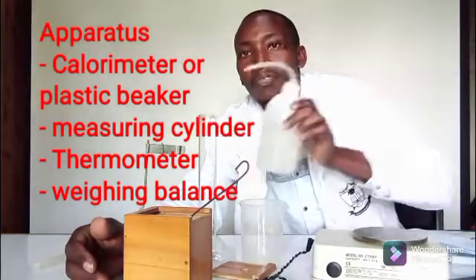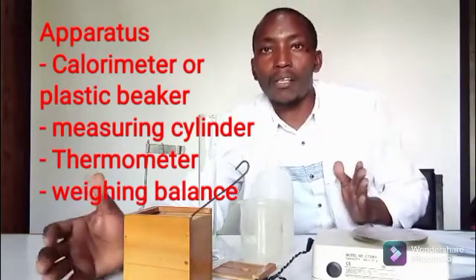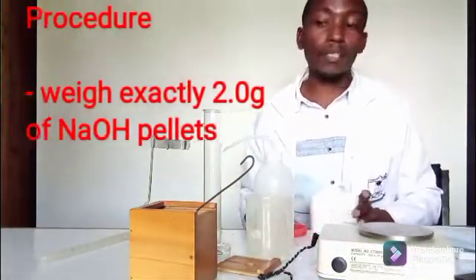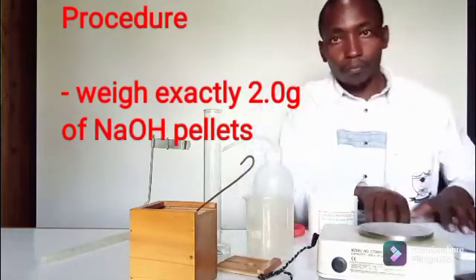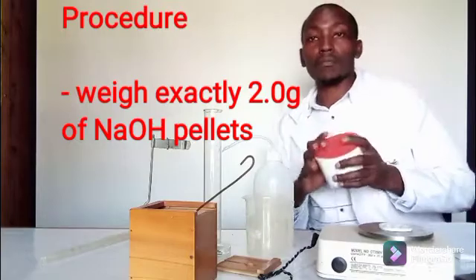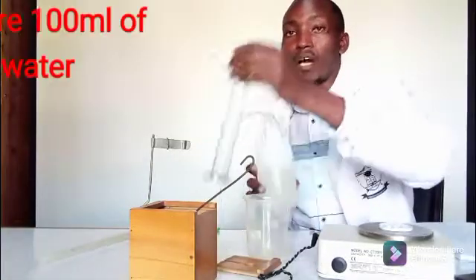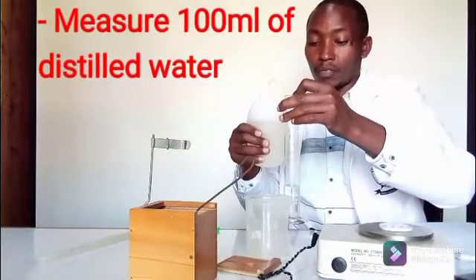I also have a measuring cylinder, some distilled water, and a weighing balance, because I need to start with a given amount of sodium hydroxide. I'm going to start with two grams — I need exactly two grams of sodium hydroxide. Then I'm going to measure 100 mL of water.